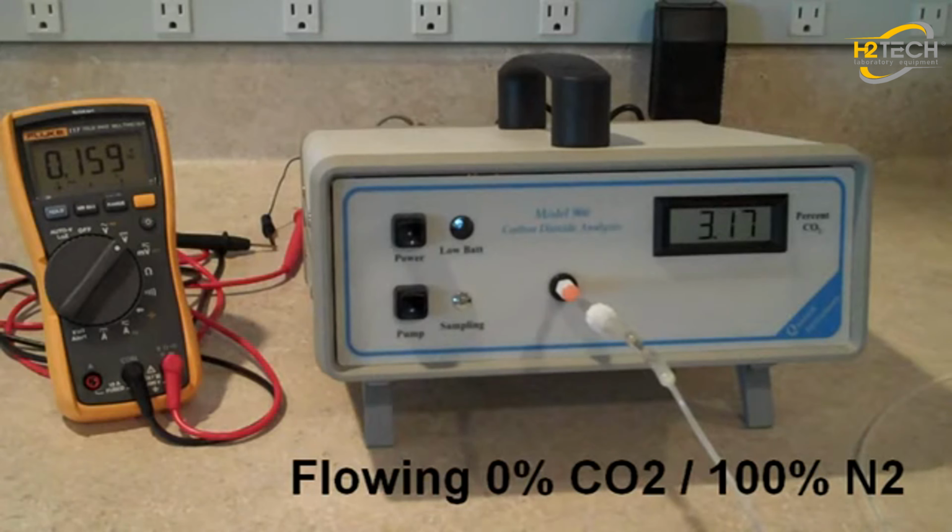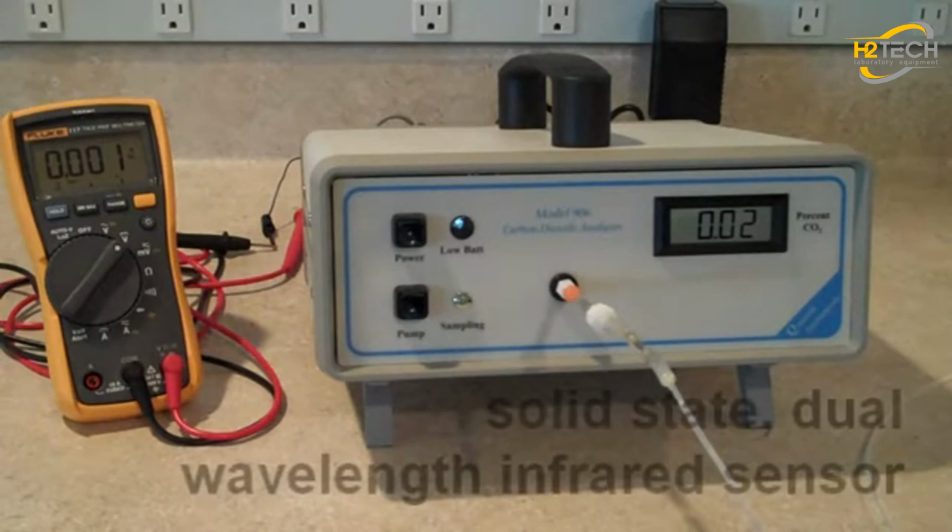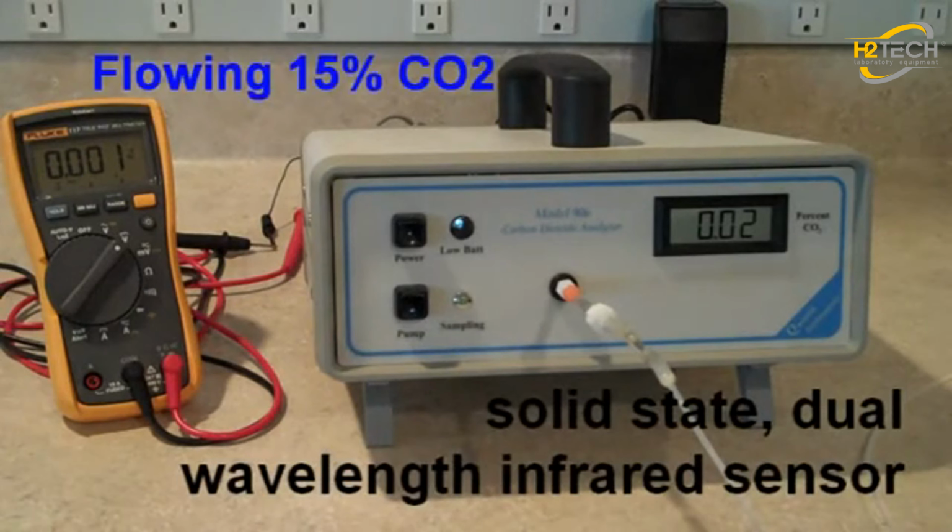Now we're going to flush the analyzer with pure nitrogen, and as you can see, the sensor responds very quickly to changes in concentration. The internal sensor is a solid-state, dual wavelength infrared CO2 sensor with no moving parts, and thus has a theoretically unlimited lifetime.